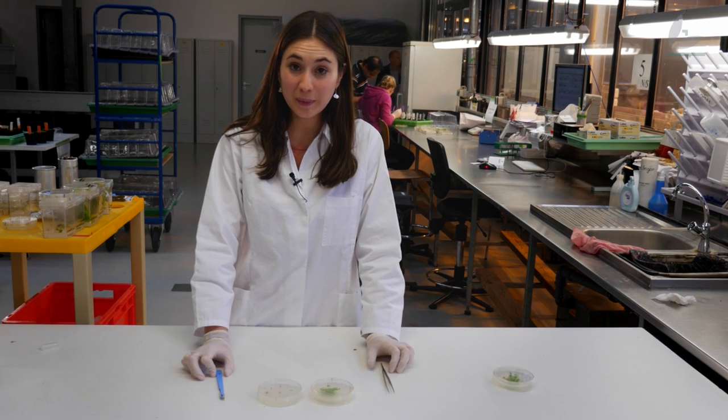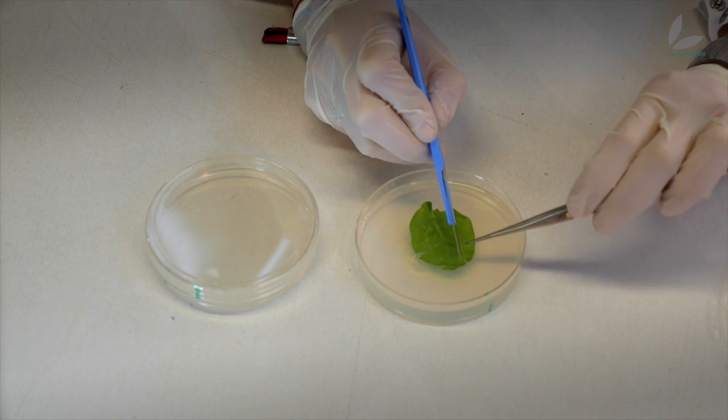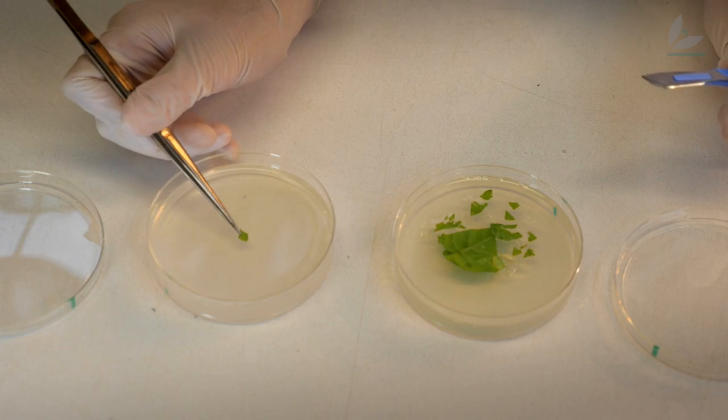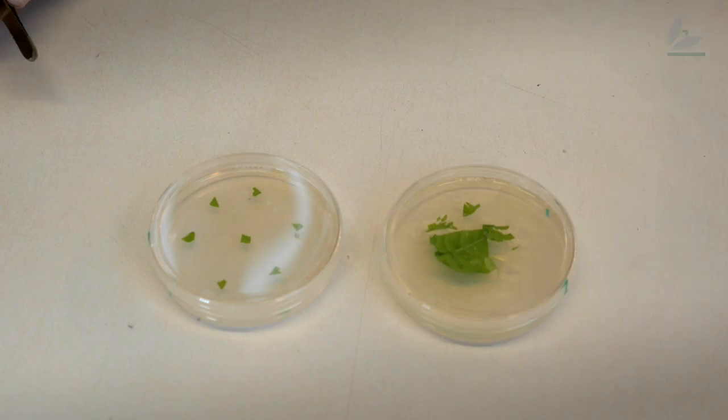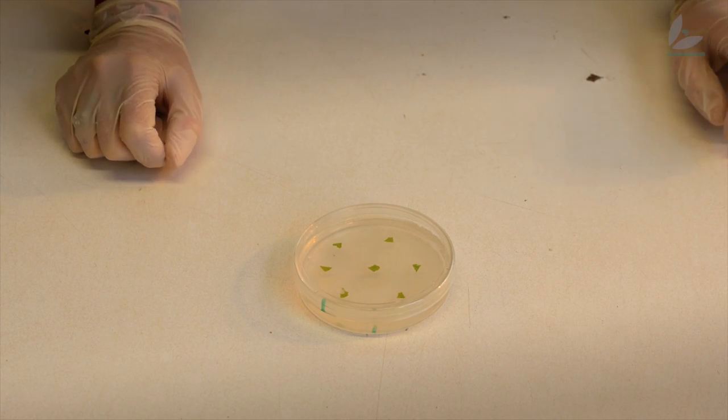I'm cutting this leaf into pieces and separating them so that from each piece whole new plants can grow. I still don't know where my gene is because the cell transformation works only in very few cells. That's why I use a trick: I linked my gene to an antibiotic resistance gene, and in this plate there are antibiotics. That means all the cells that have not incorporated the resistant gene will die, and only the cells that have incorporated the resistant gene will grow. These plants will also have my gene.